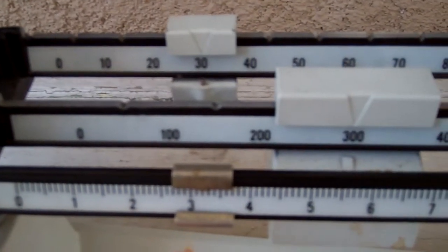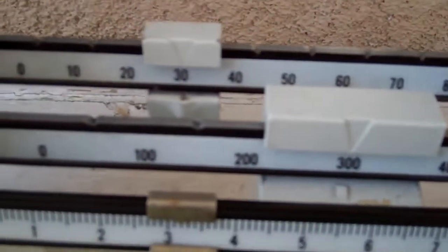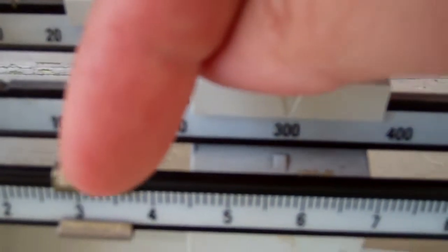So you look at that, once you get it lined up and it says zero, once you get that lined up with zero then you can read your number. So let's see how we would read this. You have to add this, this, and this together.